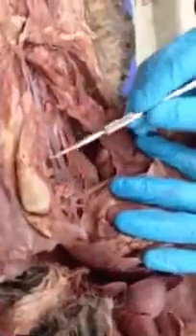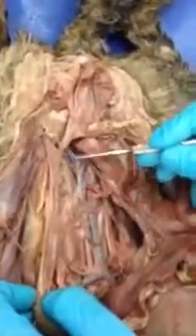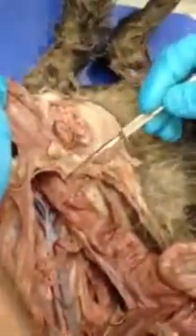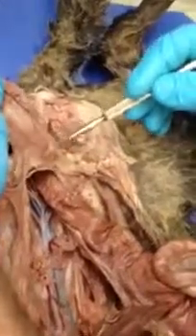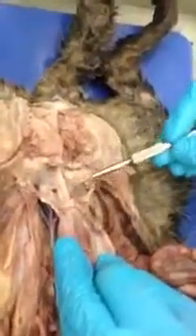And the kidney has a tube. So if we look right here, you can see the tube running in this tissue. This is the ureter, so it's coming down from the kidney. And that ureter is plugging into the urinary bladder. And so we can see that there's actually two of them. So here's the other ureter that'd be coming from the other kidney. So ureter here, and ureter here, urinary bladder. And then emptying the urinary bladder would be the urethra. So we see that single urethra.